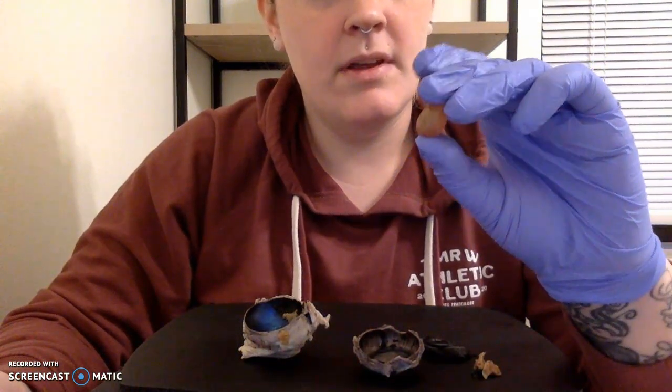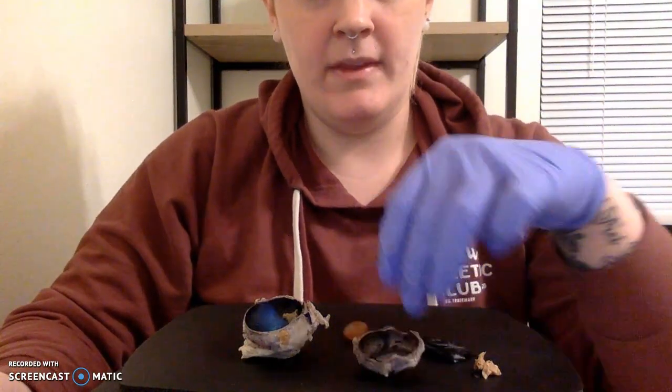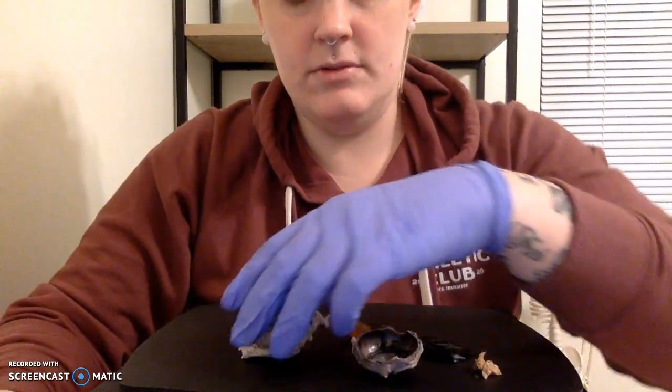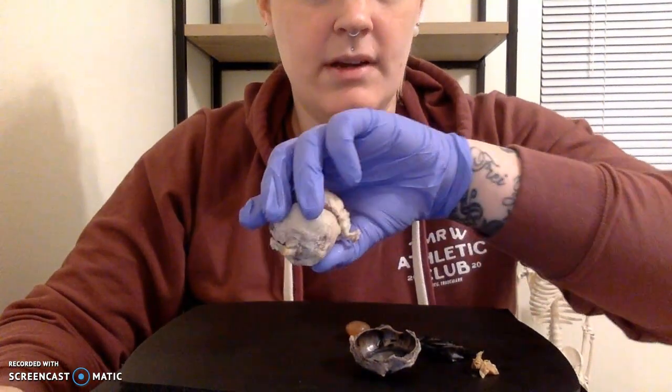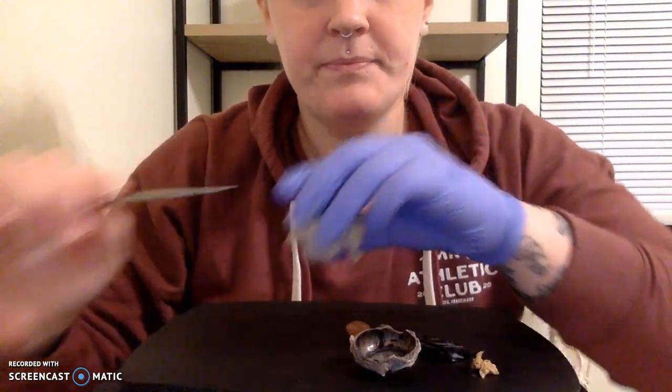So next, I want to show you the lens that we have pulled from our anterior compartment here at the front, and it is pretty solid. It's a pretty interesting shape. And then we've got our sclera. So our sclera is going to be that lining on the entirety of the eye, this thick tissue that's here.